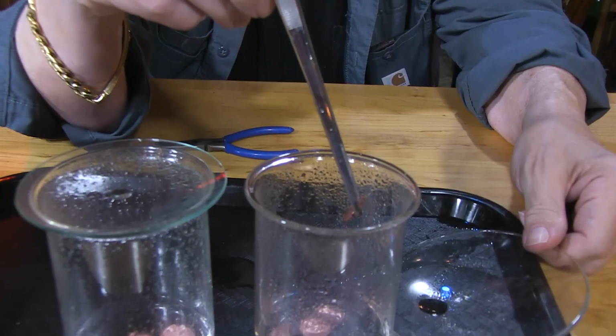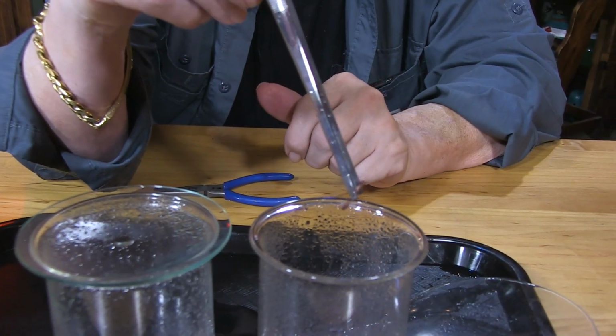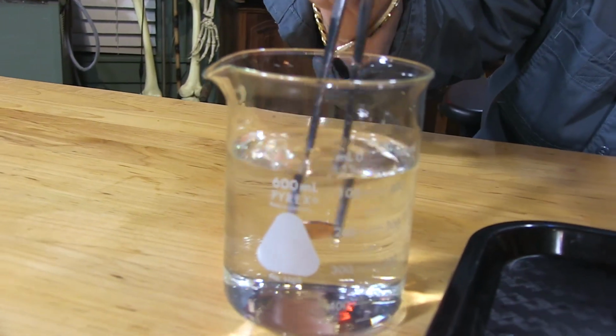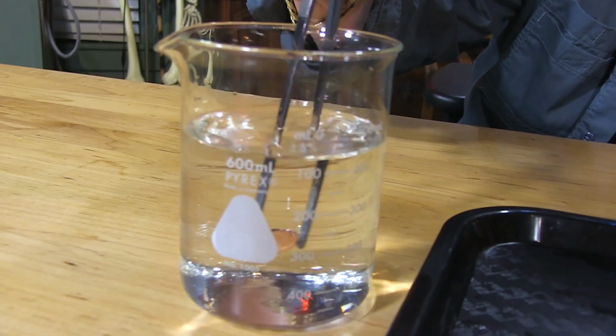Hey, sorry it took so long. I had to sneak in here late at night. We were waiting for these pennies to get hollowed out by the hydrochloric acid and it just took a little bit longer than I thought. So I left them sitting here for a few hours. So I'm gonna take it out of the acid and take it over here to the water. I'll put it in there and just shake it around.